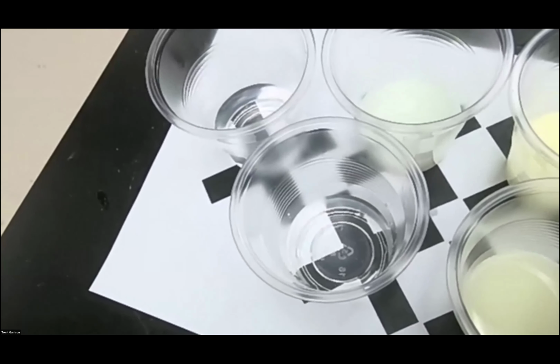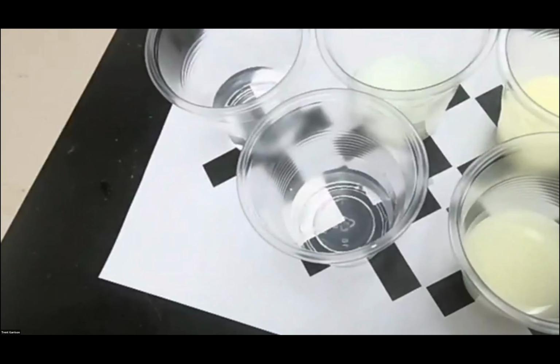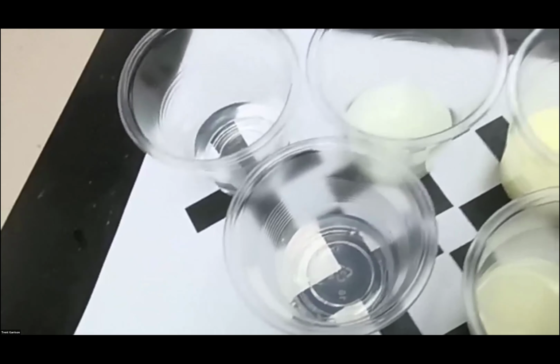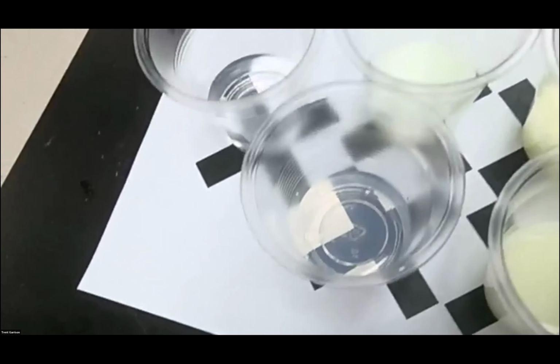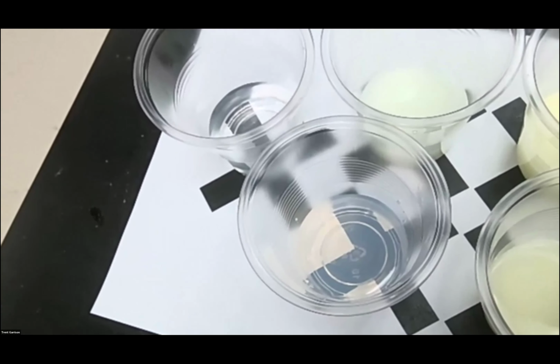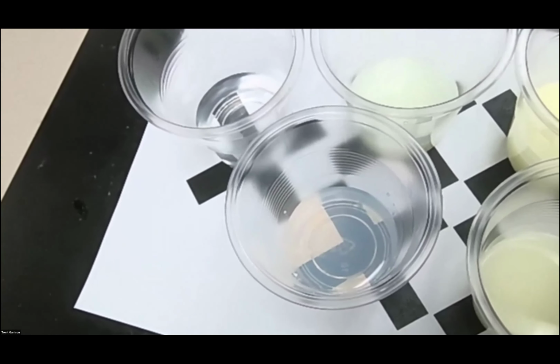And maybe that's what I'll do on the last one, because it's probably going to take closer to a minute. We are already at 30 seconds, and we're not seeing a whole lot of evidence of what could be here. So now it's starting to change. Now I'm starting to see some of that yellow color in here. It's very slow, but it is starting.